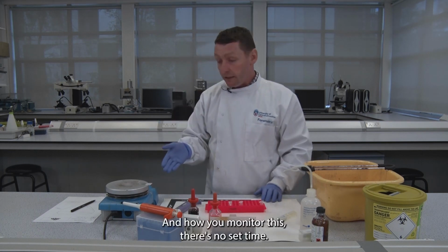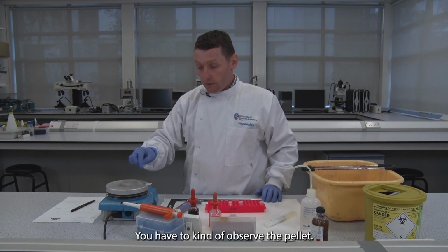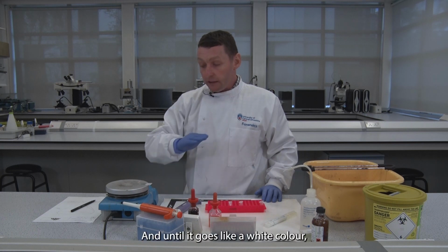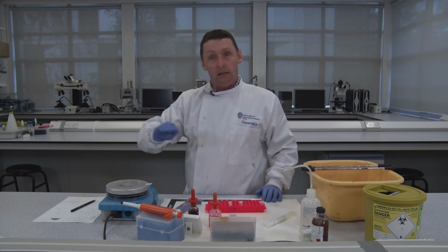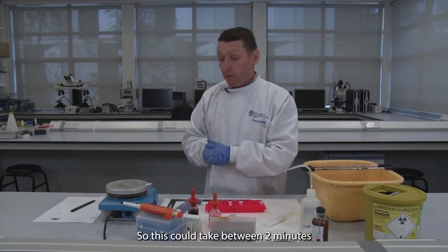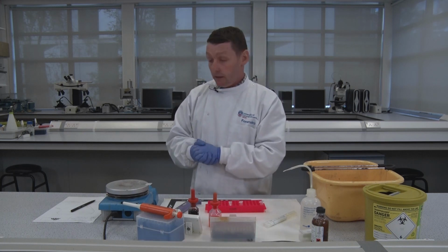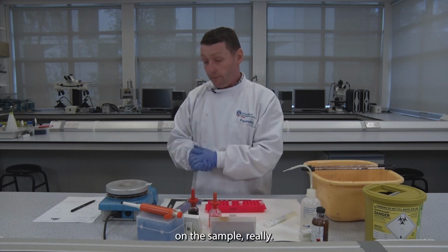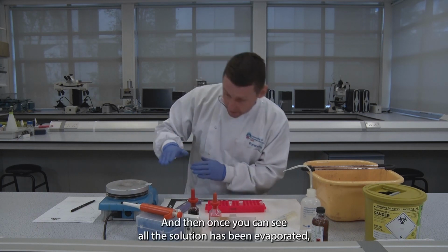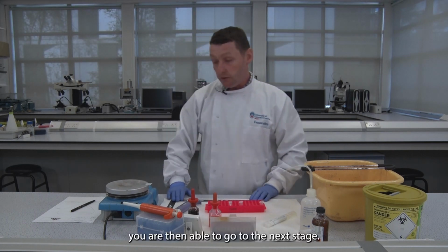How you monitor this, there's no set time. You have to observe the pellet, the cells, just kind of evaporating, until it goes a white colour, and you know that it has now stuck to your microscope slide. This could take between 2 minutes or 3-4 minutes, depending on the sample. It dries from the outside inwards, and once you can see all the solution has been evaporated, you are then able to go to the next stage.